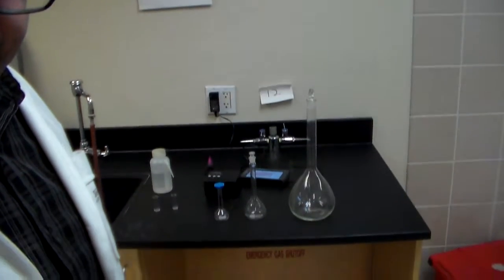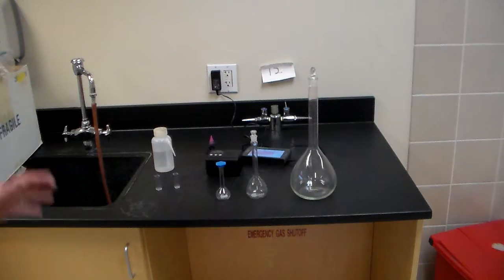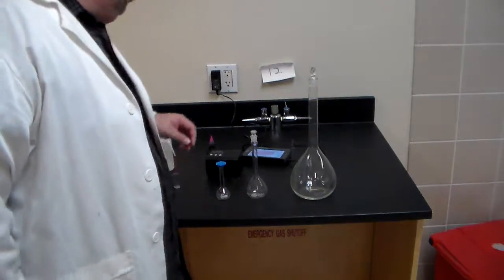The other question that we're going to look at is, if we were to graph the concentration of our food dye compared to our percent light transmittance through our colorimeter device, what kind of a graphical relationship are we seeing? Now, in order to get to that, there's several things that we're going to have to look at. One, we got to figure out a way to dilute our concentration.